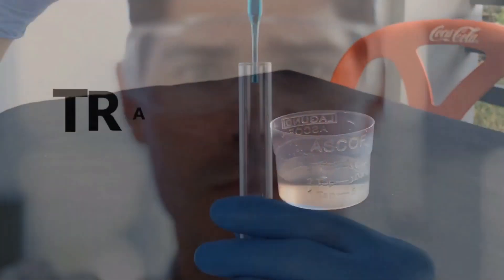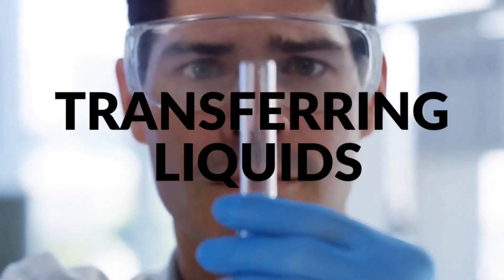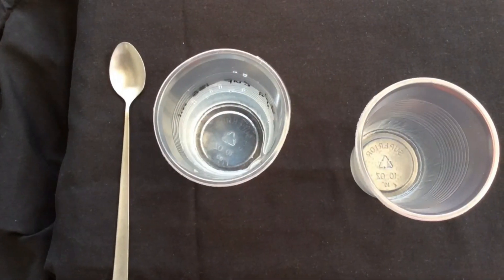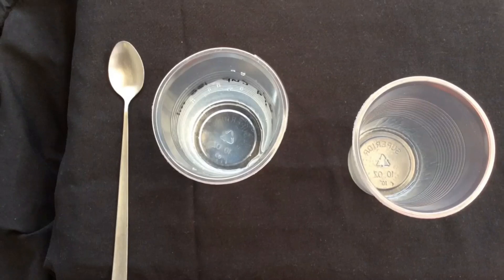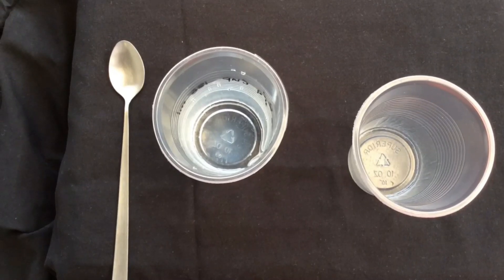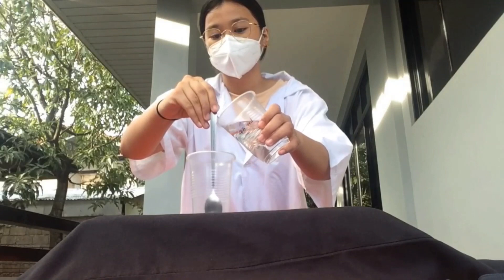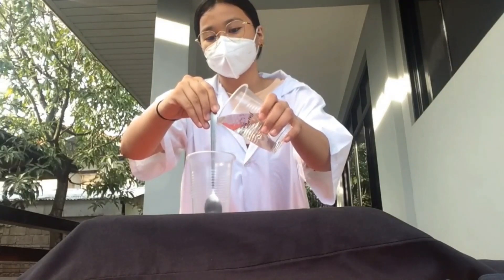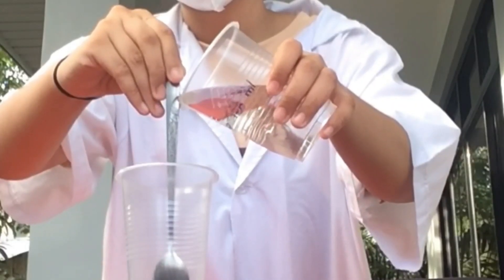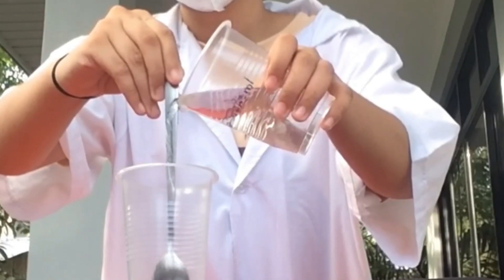The next common laboratory operation is transferring liquids. In this process, we will need a spoon, 2 cups — one empty and one filled with water. Why do we need to use a spoon in transferring liquids? It is to prevent spillage of water and to gain the maximum amount of water transferred from one cup to another.